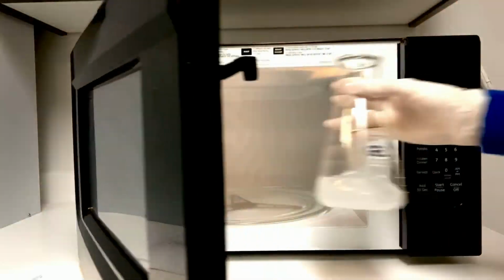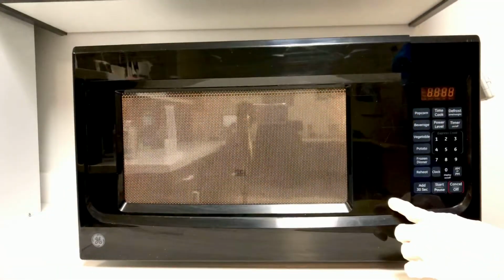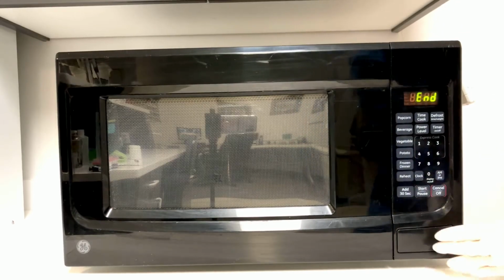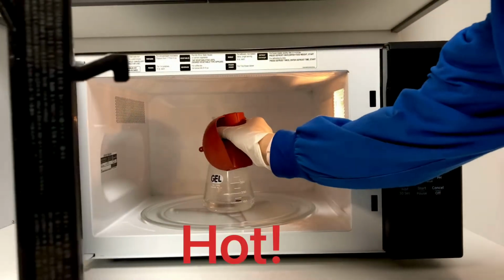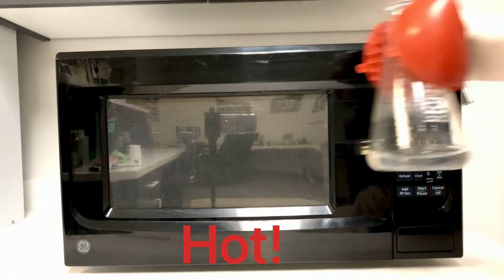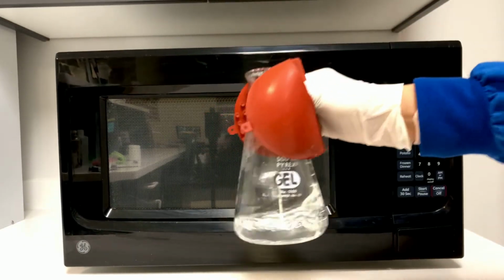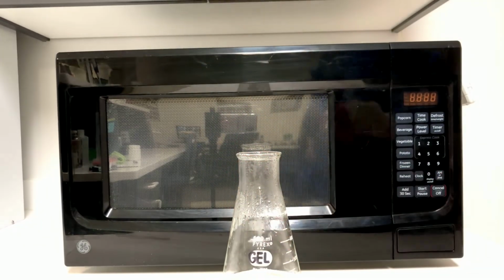Put the flask in a microwave and microwave for a few minutes until the agarose is completely melted. The flask will be hot, so be sure to use oven mitts when removing the flask. Give the flask a swirl to mix. Be very careful of the flash boil when doing so.